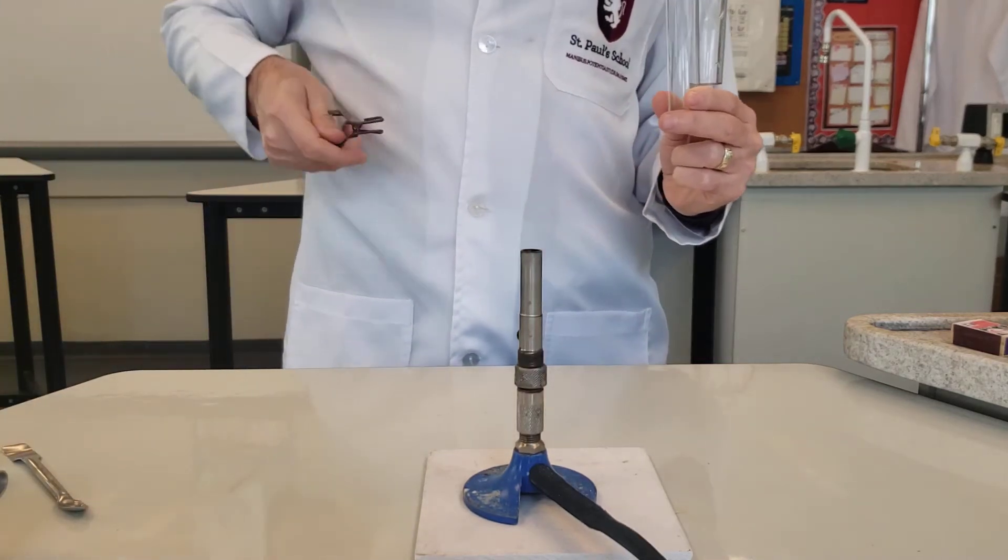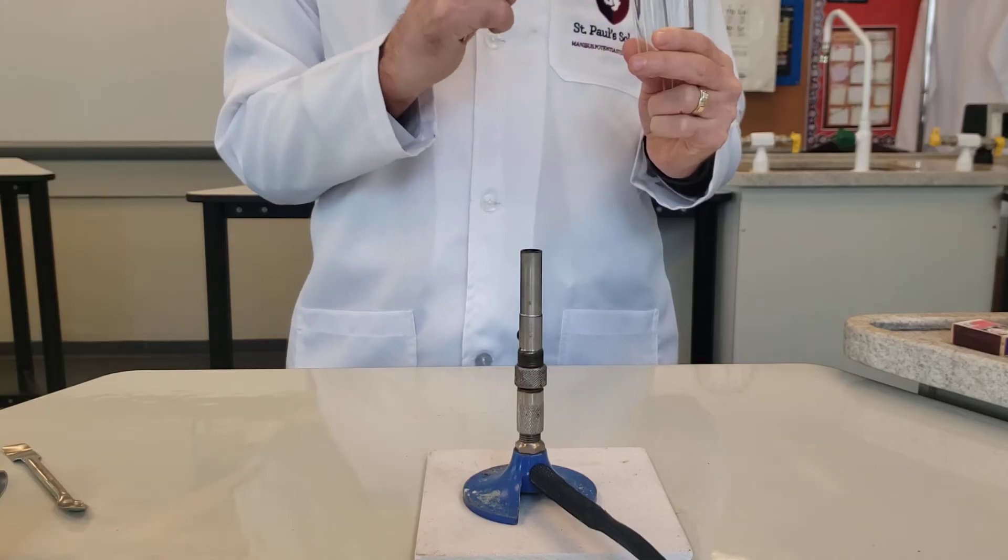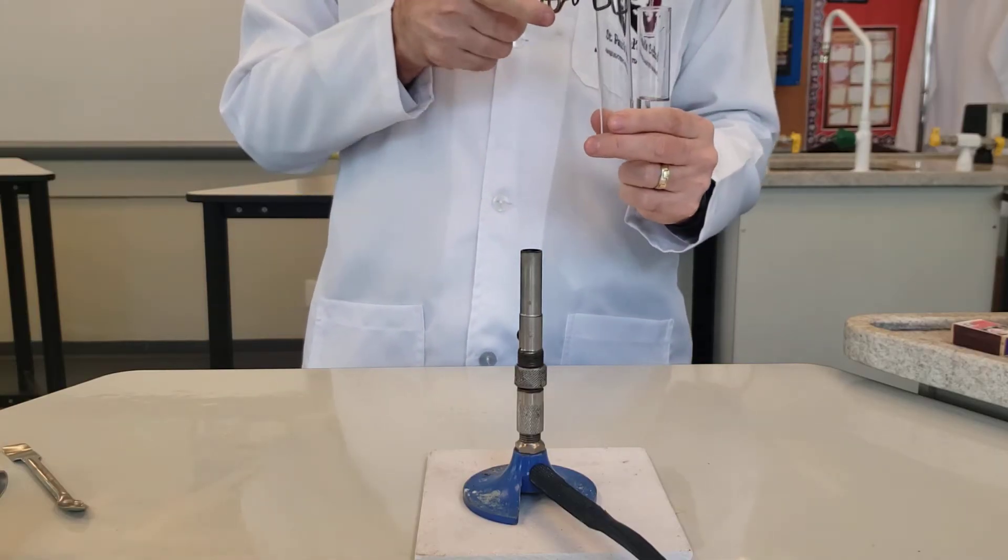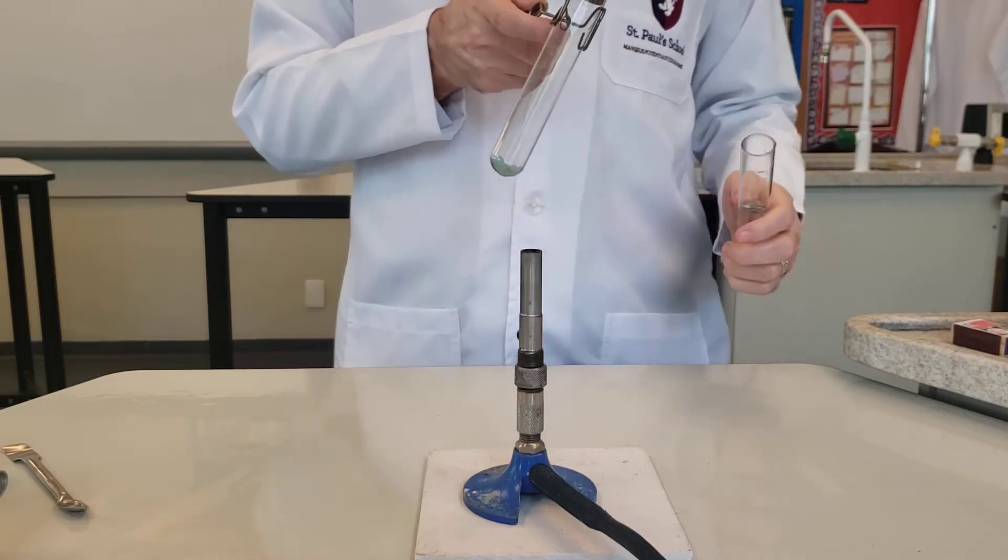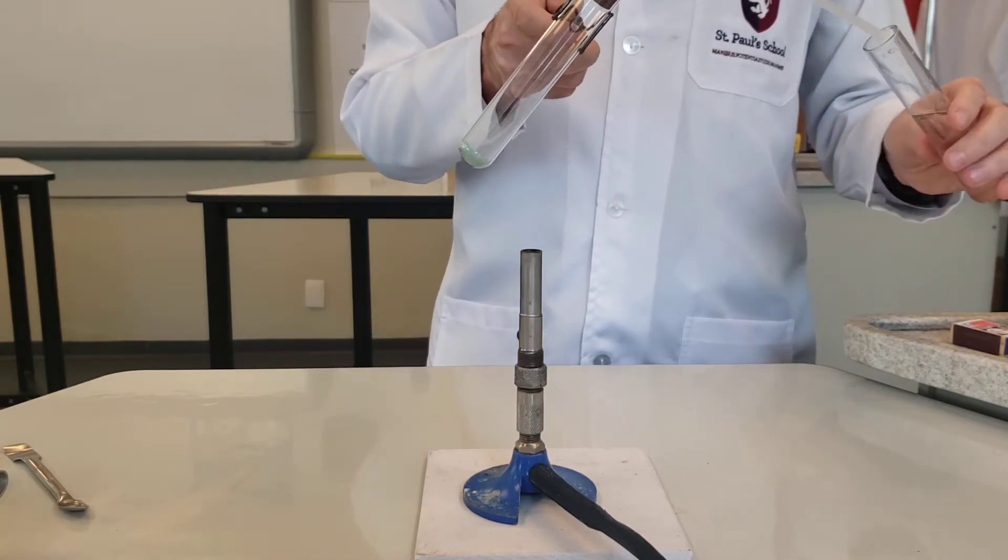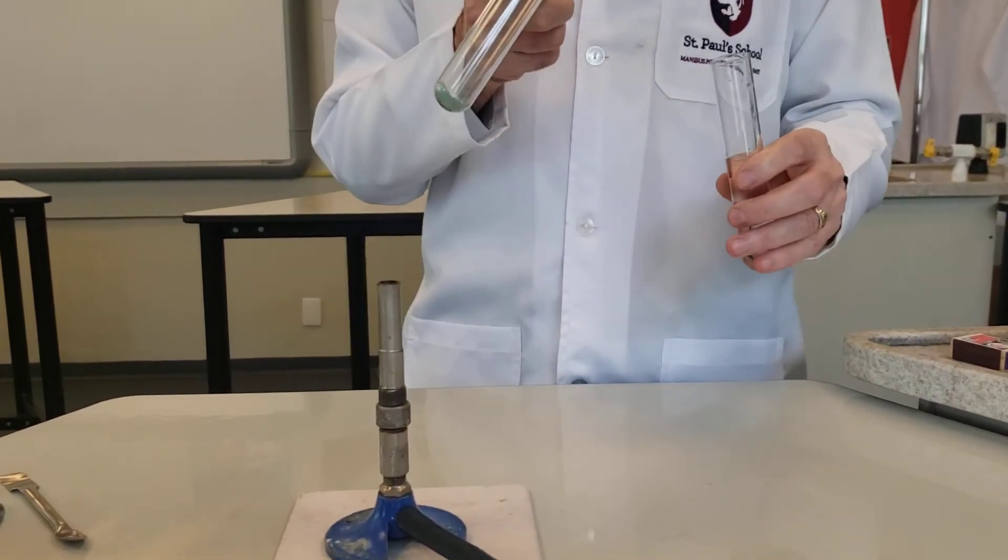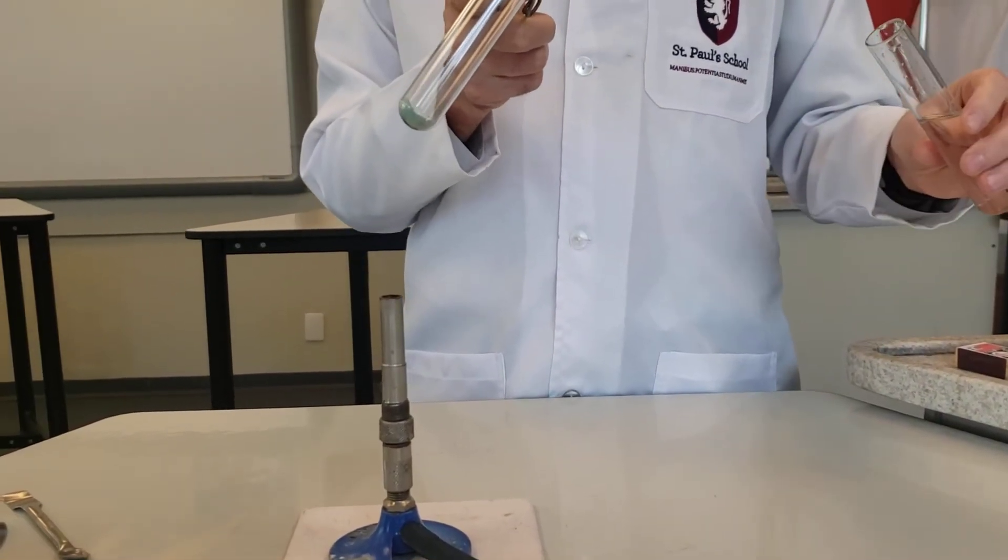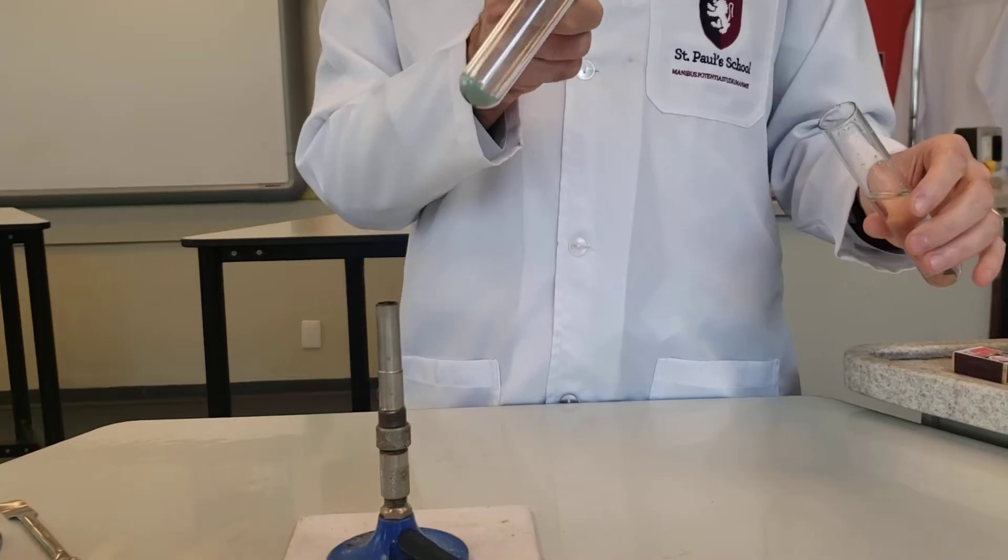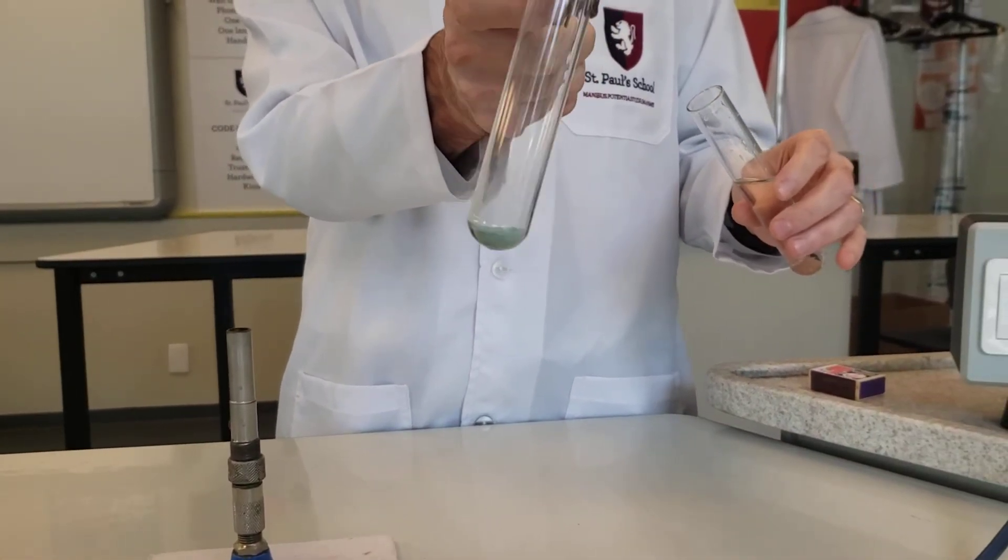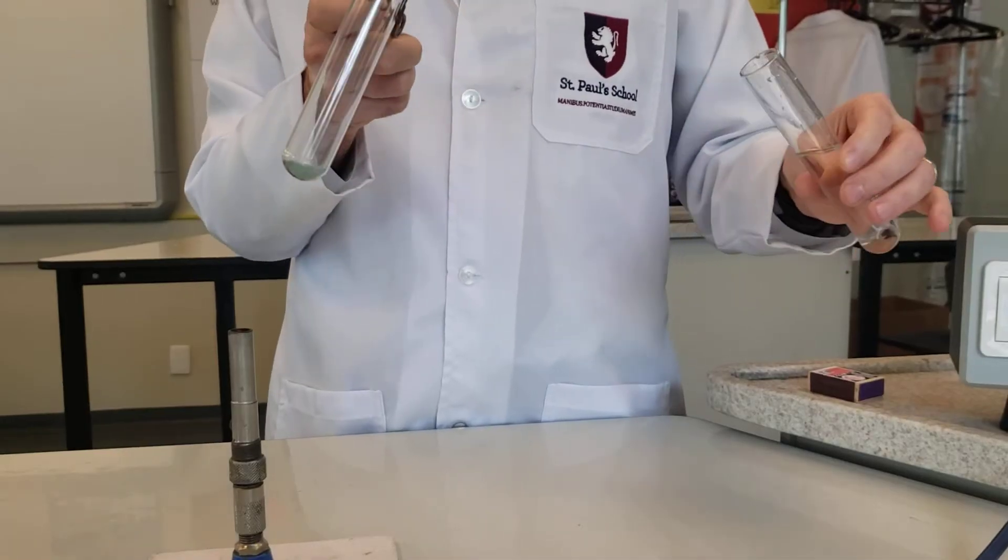And hold my boiling tube with a test tube holder. Like so. So I'm going to heat it gently and pass any gas formed into the lime water. Pay attention to any colour change or anything else you can observe in the reaction. Here we go.